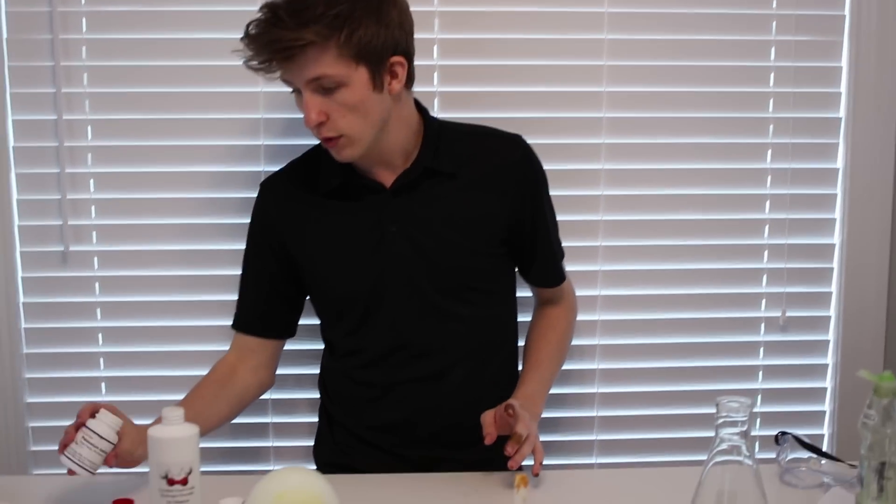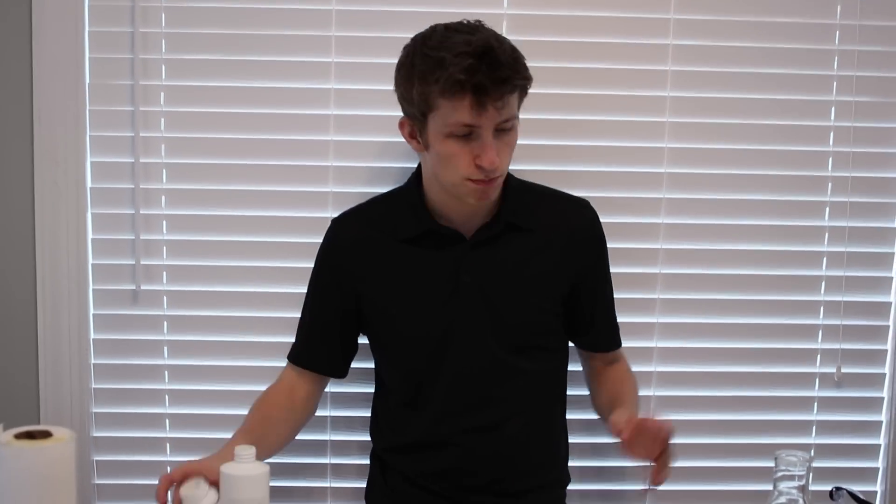And it didn't hurt. It's not burnt. It's not injured or anything. I think it just dyed the pigment on my skin. Yikes. So we have this huge mess right here, guys. We're going to clean all of this up, and then I think we might use the rest of this, put it in this vial, tons of soap, tons of food coloring for one grand explosion, guys. So we'll be right back.